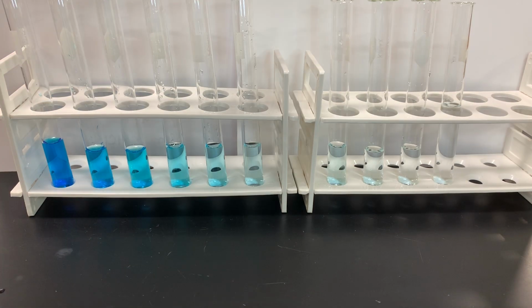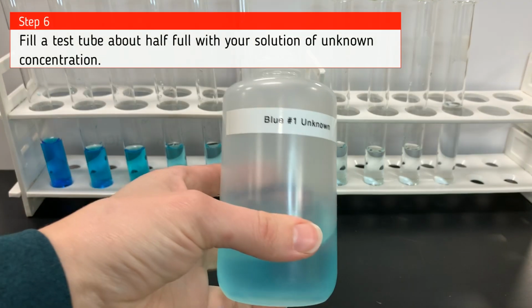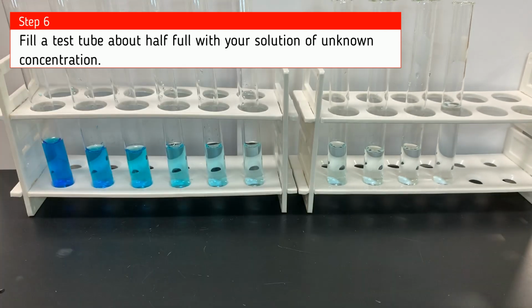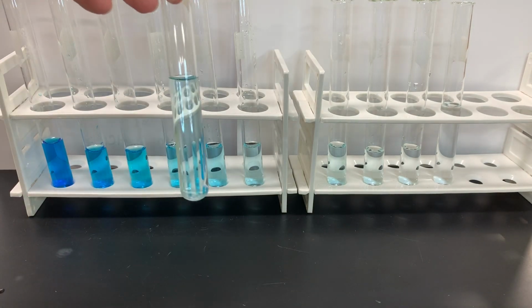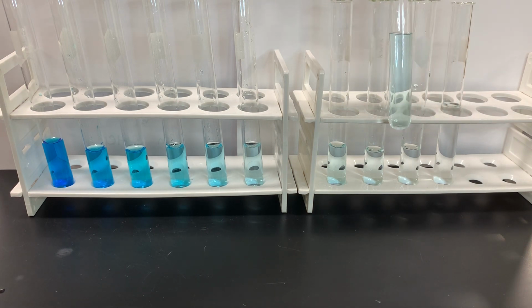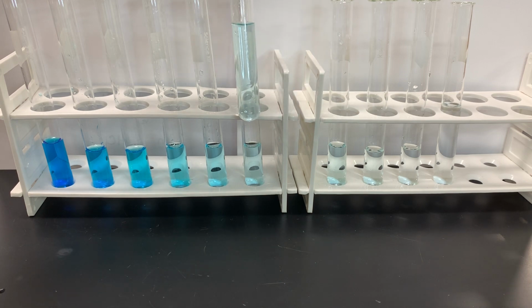So now that I'm done with my last solution, I've put some paper behind these solutions so you can see how they progressively get less and less concentrated. The last thing I'm going to do here as I set this up is put my unknown concentration in a test tube. I'm going to fill a test tube about half full of my unknown concentration. And I want you to just eyeball it and see which of these dilutions matches that unknown the most.